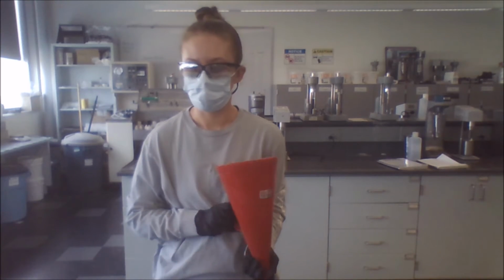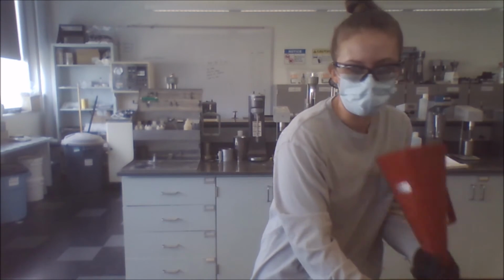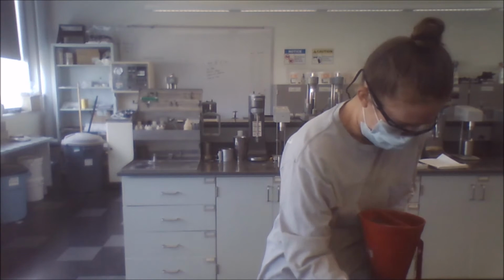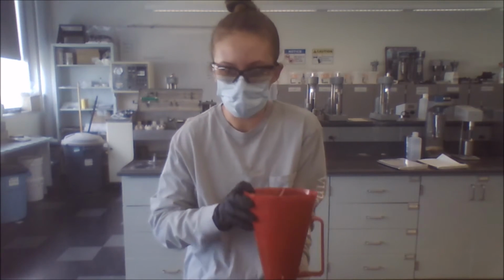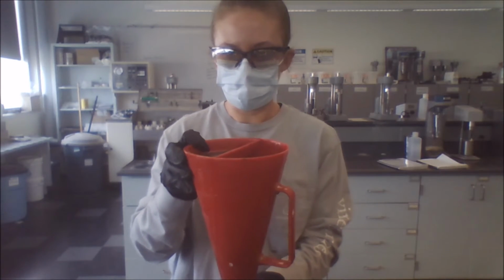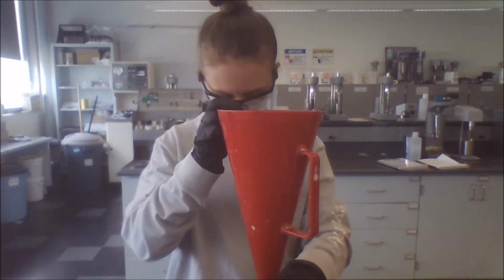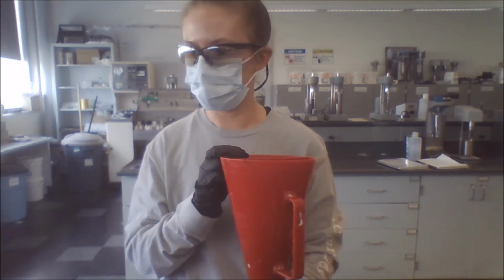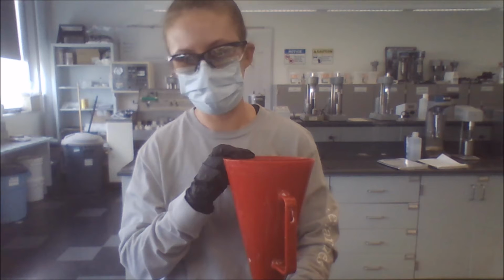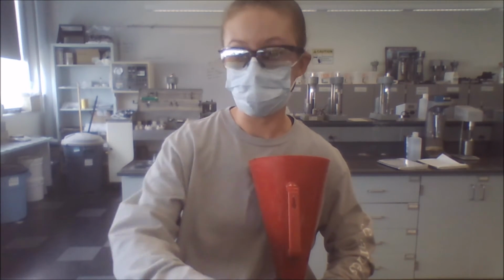Okay, so we're going to run a test with water. The first thing we need to do is fill up our Marsh funnel. So we want to get a good seal on the end with our finger and then pour our water into that mesh. And then using an empty cup, we're going to time how long it takes. We're going to start the timer in 3, 2, 1. And then we're going to stop our timer, and it looks like the Marsh funnel viscosity for this test was 26.42. I'm going to run the second test off camera, and then I'll be back with the complete result.